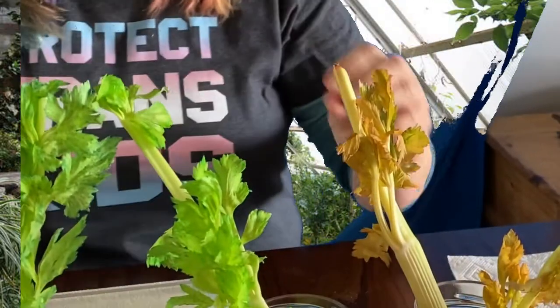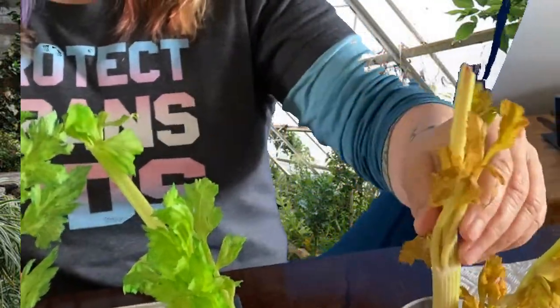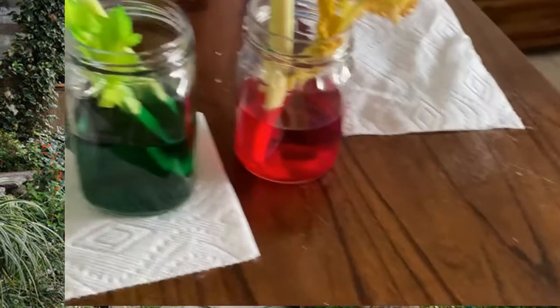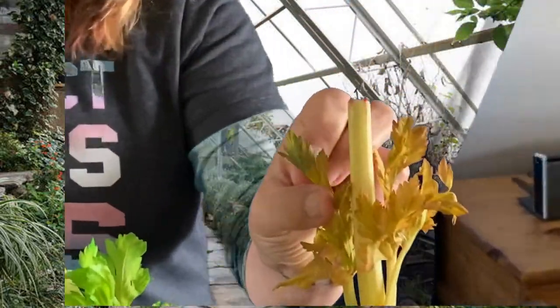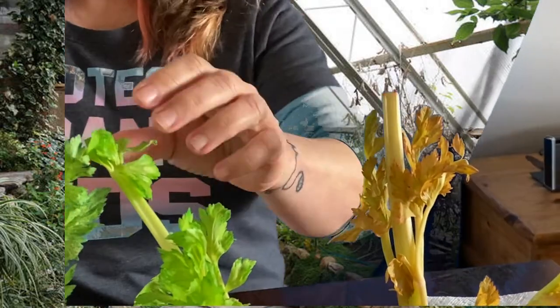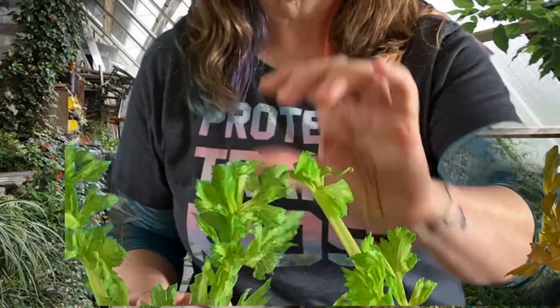So the purpose, remember, of this lab is to see how transpiration works, that the xylem are the little tubes that come up through the plant and take water in from the roots through the xylem and all the way out to each cell. So each leaf has had the water coming up and out of it, and then it evaporates out of the leaves. This is transpiration, right? The movement of the water through the plant, in from the roots, through the shoots and stems, all the branches going out to the leaves.